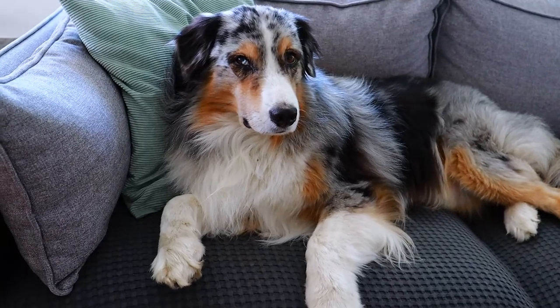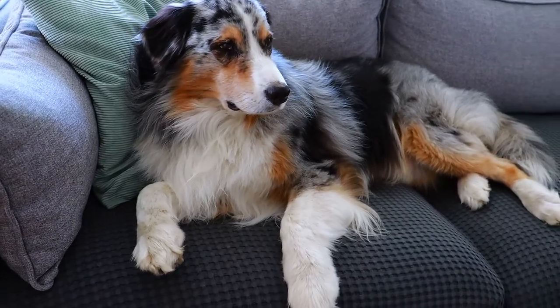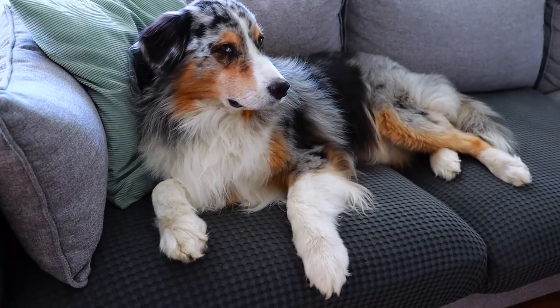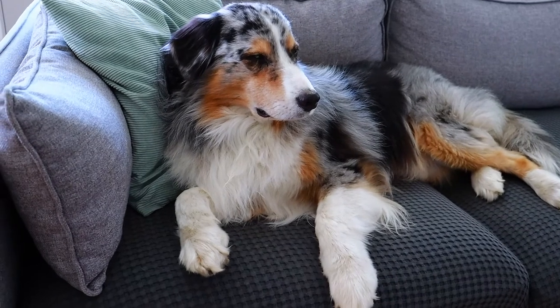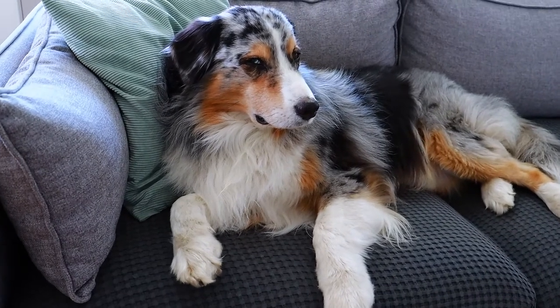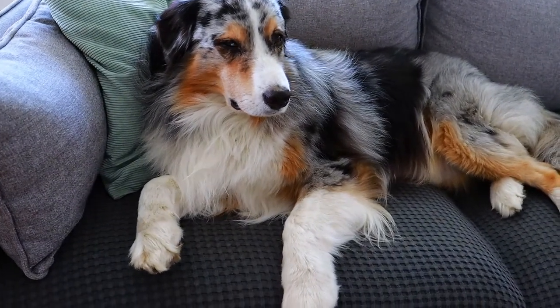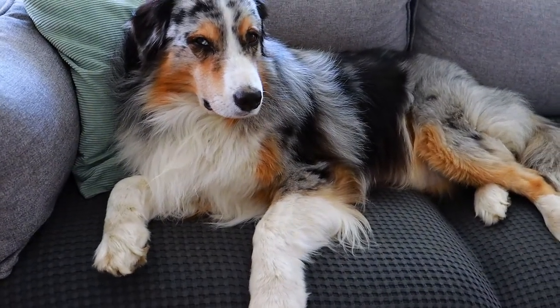So my dust will probably consist of a lot of dog hair, and you'll likely find a fair amount of sand particles in it as well.